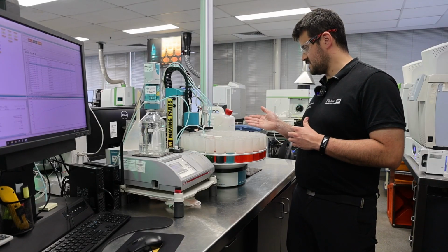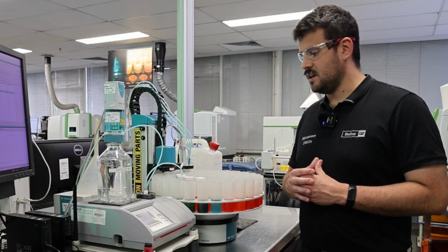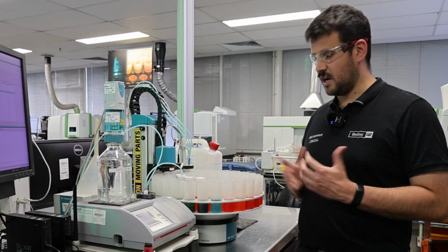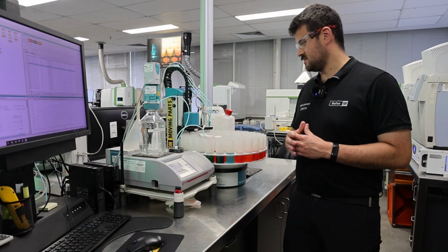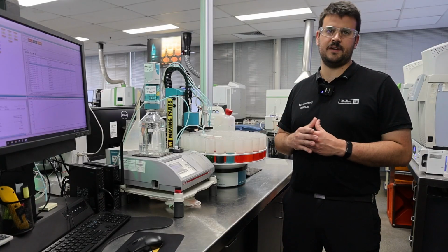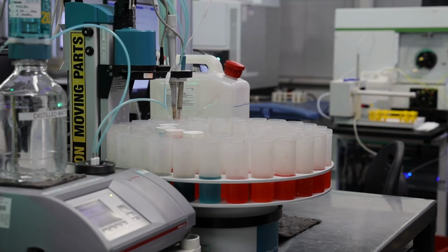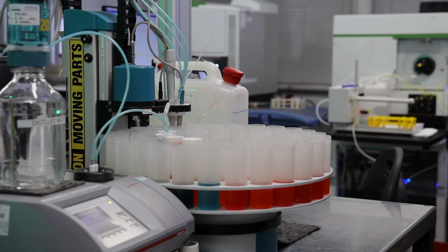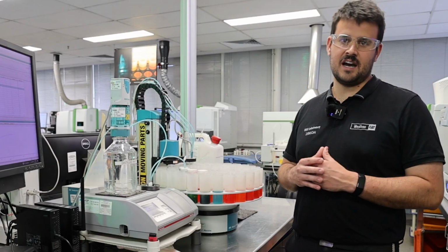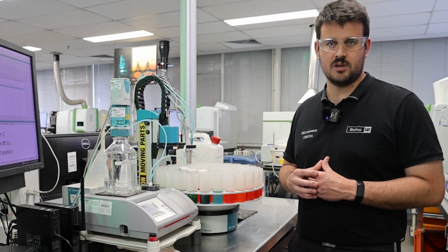One of the other tests it does then after this is the refractive index meter over here. What this is testing for is the amount of glycol or ethylene glycol still in your coolant sample, otherwise known as antifreeze. The way it does that is it fills the cell inside of here with your coolant sample and then shines a specific wavelength of light through that cell. Based on the amount of light that's absorbed and allowed to travel through that cell, it can calculate the percentage by volume of ethylene glycol in your coolant sample. Again, giving us an idea of what the current state of your coolant sample is and whether it's in a good state to keep doing the job that it's supposed to do.